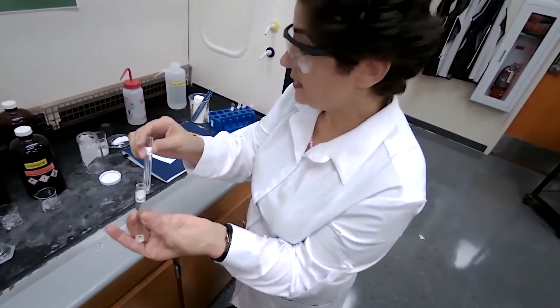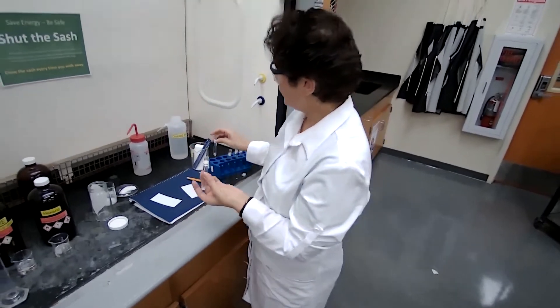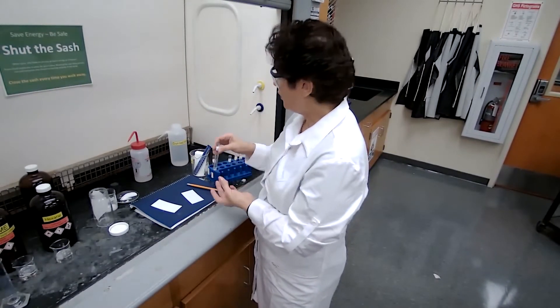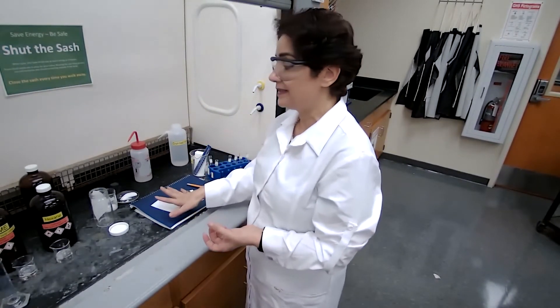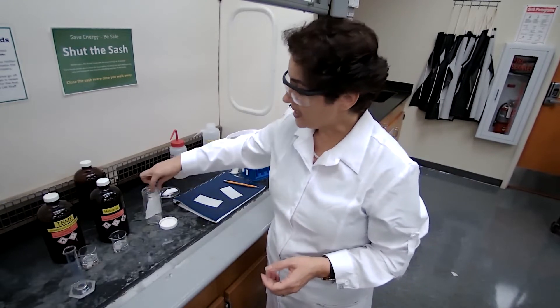So I have the solutions, I have my samples, but not here. But before I put the samples on the TLC plate, just like for part A, I'm going to make my developing chamber. The developing chamber, piece of the filter paper goes into the jar.